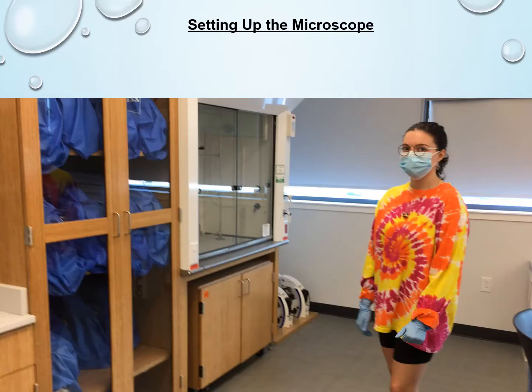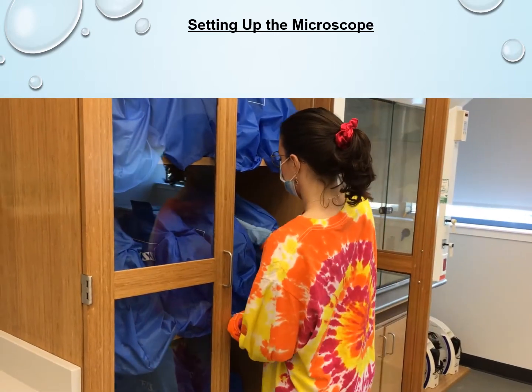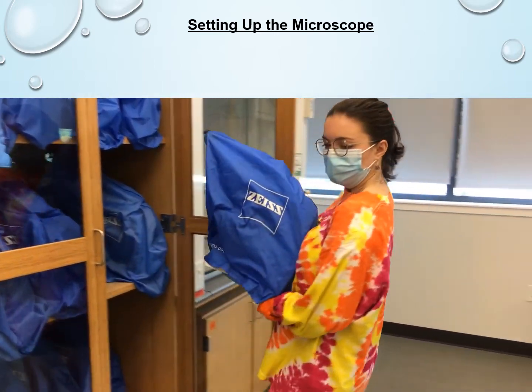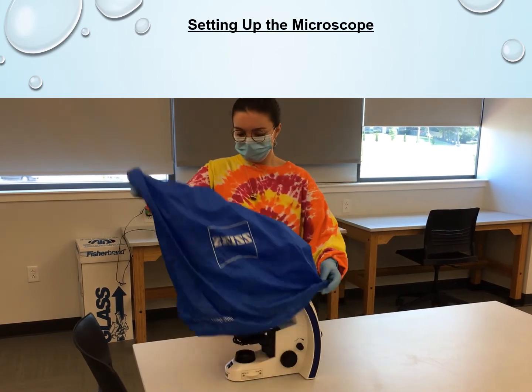In this video, you will see Emily setting up the microscope, and I will pause the video as I go through it so that I can explain things as we go along. So first thing that Emily does is she picks up the microscope, and you'll notice she does it with two hands, which is very important because the microscope is quite heavy and you don't want to drop it and hurt yourself or break the microscope.